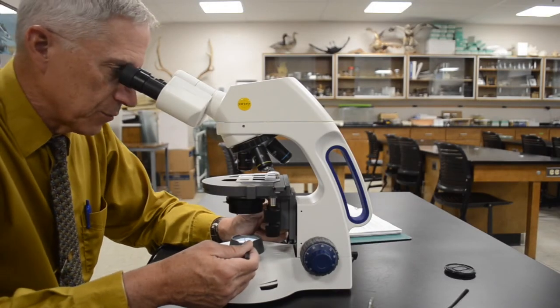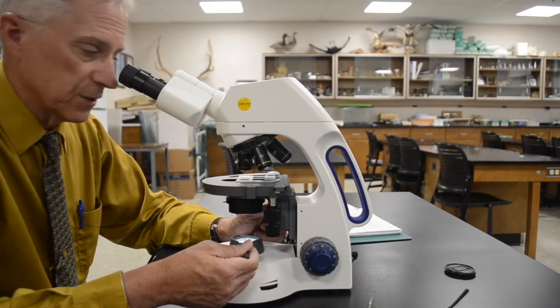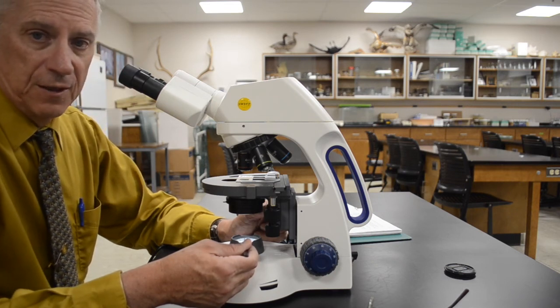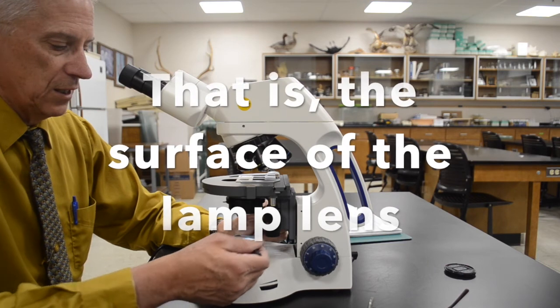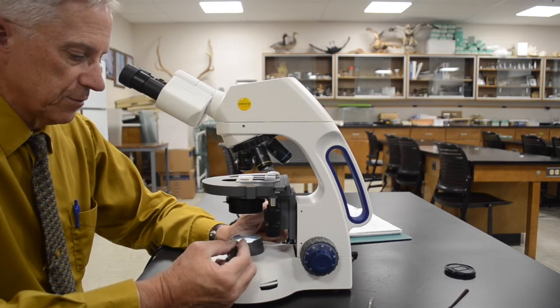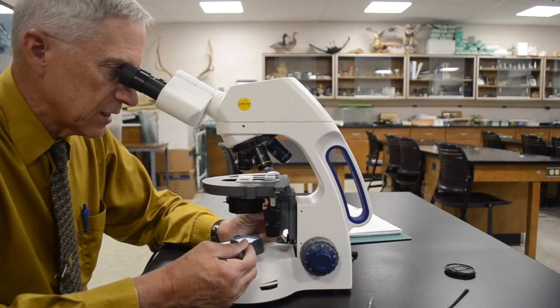Around the edge of the probe tip, which is now in sharp focus, you'll see a general mottling pattern. That's because the condenser has focused the light from the surface of the lens glass as part of the image. So look through the ocular lens and adjust the condenser knob just a little bit in either direction until that mottling disappears.